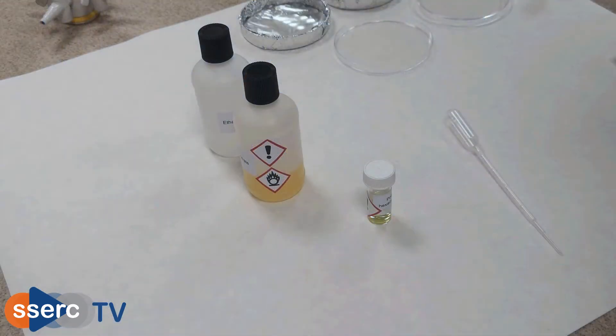Hi everyone. Now we're going to move on to the second of our cyanotype experiments. This time we're going to be using the same chemistry to look at the effectiveness of sunscreens.